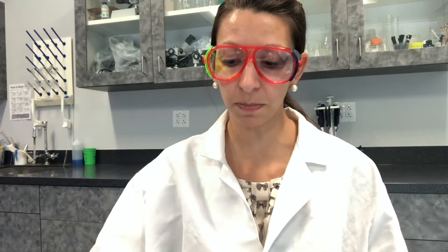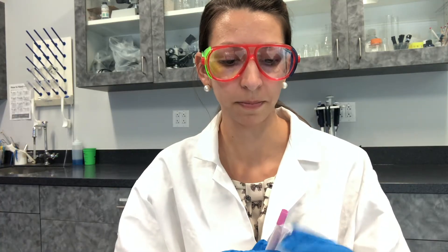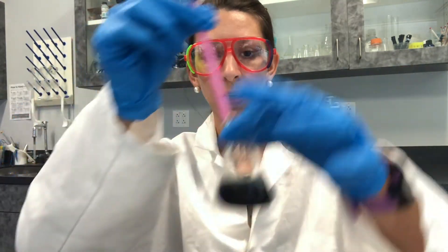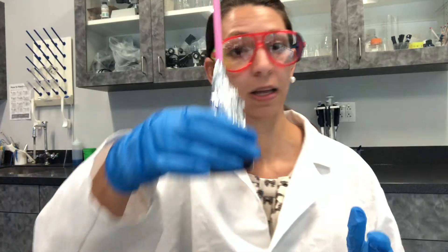First we're going to put our bromothymol blue solution into a small flask. Then we're going to take a straw and place it into the flask so it's touching close to the bottom. Then I'm going to place aluminum foil over the top so that in case I blow too hard, no bubbles are going to splash back at me, but I still want to make a small hole for the straw. Our final setup will look something like this.